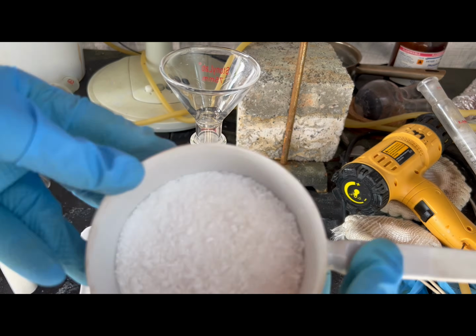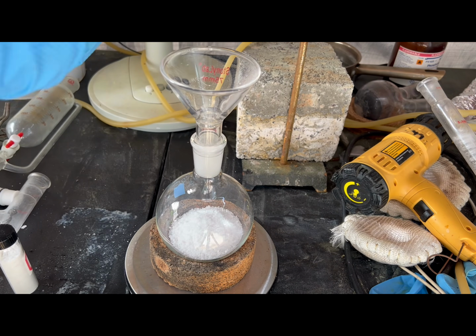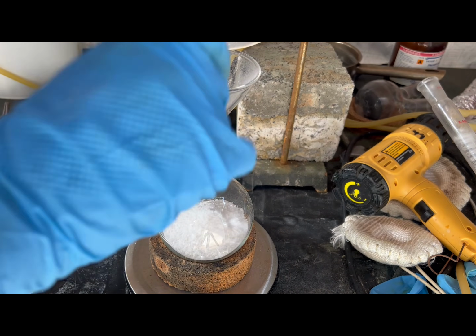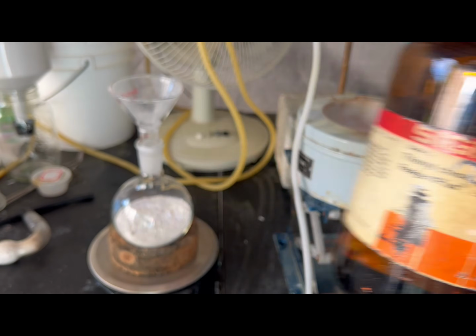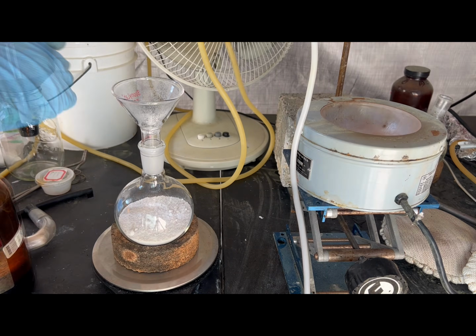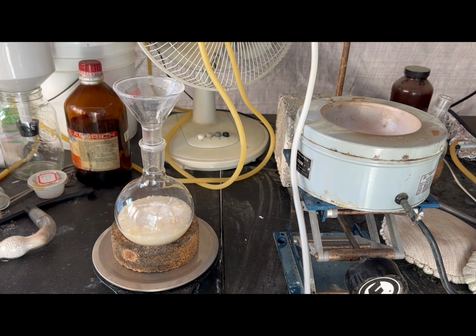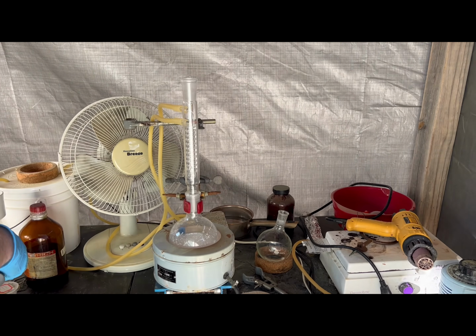I crushed them up using a mortar and pestle, then added it and the benzoic acid I already had to a 500 milliliter round bottom flask. I added the thionyl chloride and set up for reflux with a calcium chloride tube attached to the condenser. For those of you that have worked with thionyl chloride, does it smell sweet to you? I like the smell of it before it starts to hydrolyze. It's a nice smell even though it's a super toxic substance.